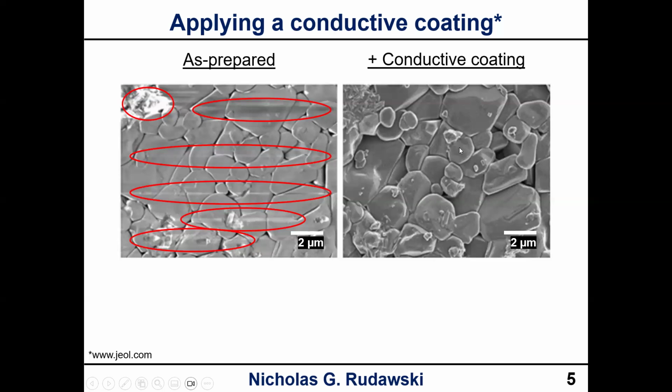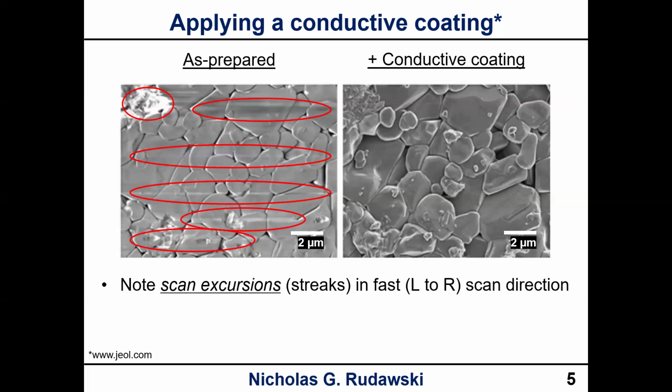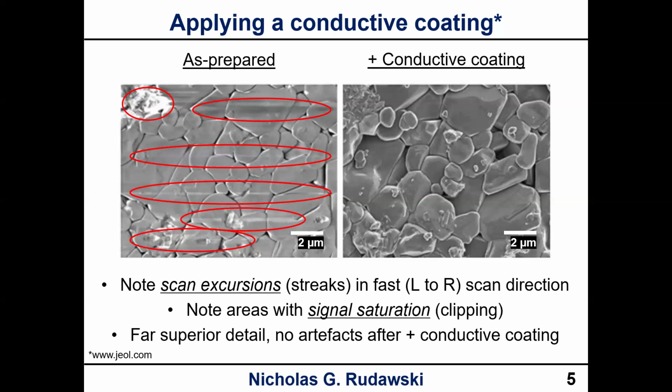And this is actually the exact same area that we were seeing on the left, right? So you can see the left sample actually looks kind of flat, and the one on the right, once we apply the coating, allows us to see the actual morphology far more accurately, okay? So again, this is an example of why charging is not good and how it can affect what we're seeing and the results that we're seeing, and trying to get an accurate picture of the sample, okay? So we note the scan excursions in the fast left to right scan direction. We note that we have areas with signal saturation, which is the same thing as clipping, okay? And we notice that once we add the conductive coating, we see far superior detail, and we don't see any artifacts either. We don't see the scan excursions, we don't see the signal clipping either, okay?